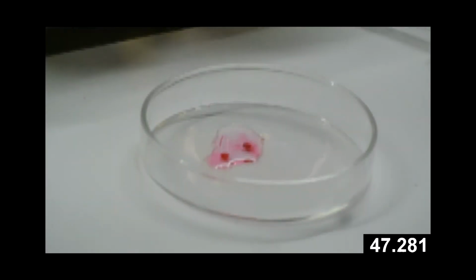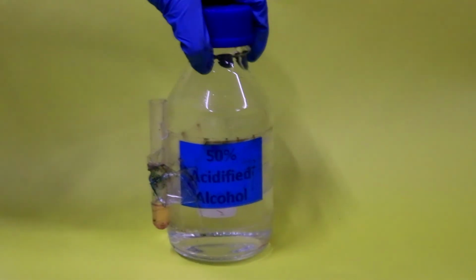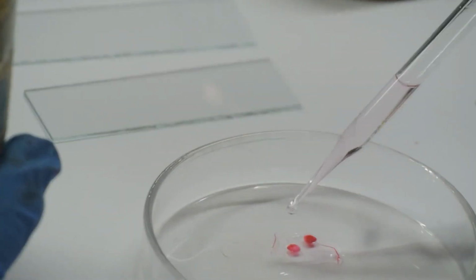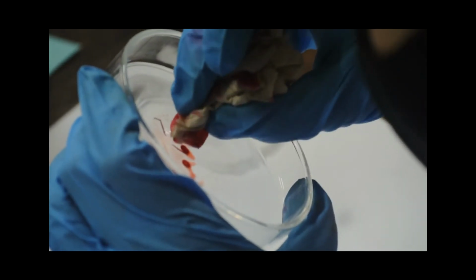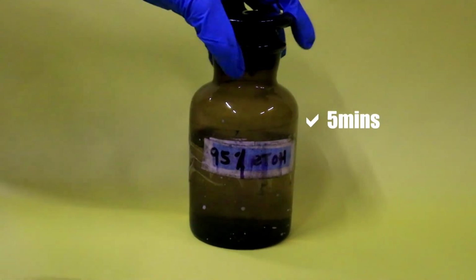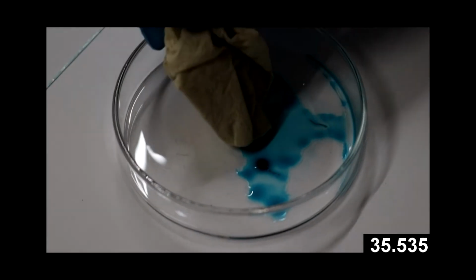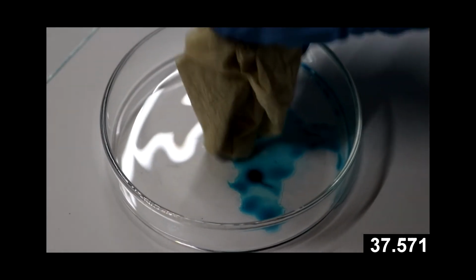This may sound a little counterintuitive, but too much stain will obscure the characteristics of your specimen's cellular structures. Step 6. Put the specimens in 95% alcohol for 5 minutes to stop the decolorizing effect of the acidified alcohol. Step 7. Soak them in fast green for 30 to 60 seconds and then wash in 95% alcohol.